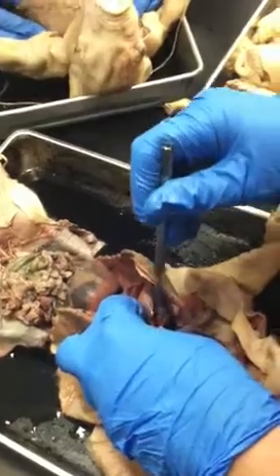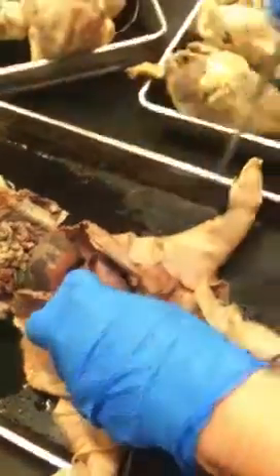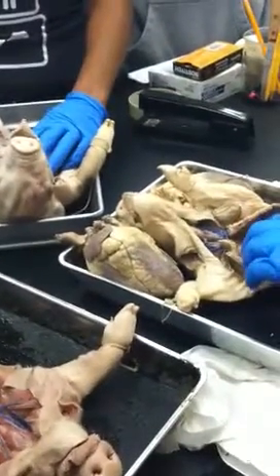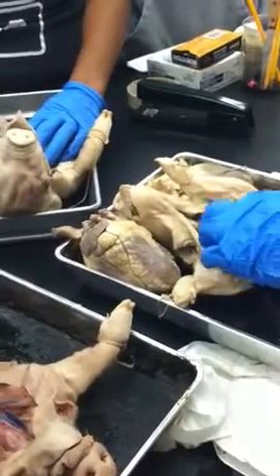It should dump in right there. So you follow that pulmonary trunk where it links with the aorta. Intercostals again, those pink lines. Here you can see, I guess, the veins pretty well. Probably more so down there again. And the dorsal aorta has the aortic arch and descending arch.